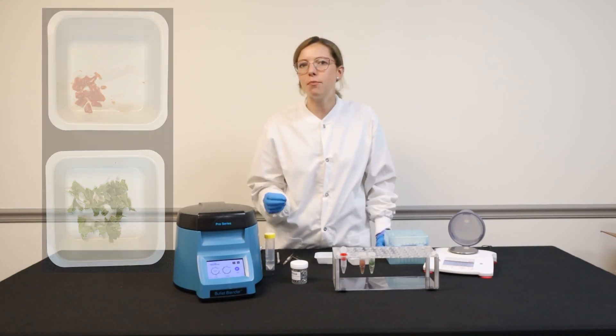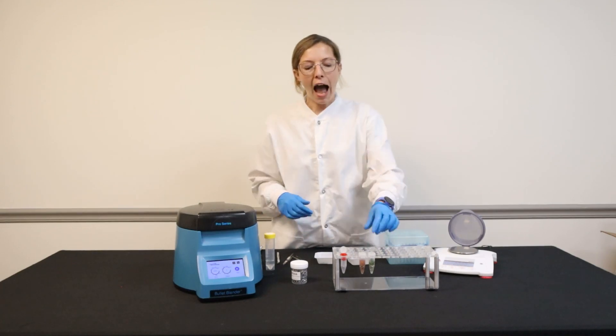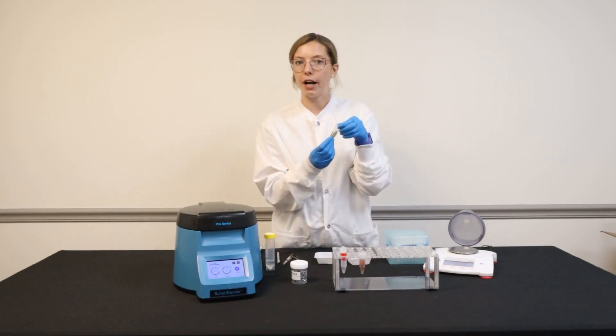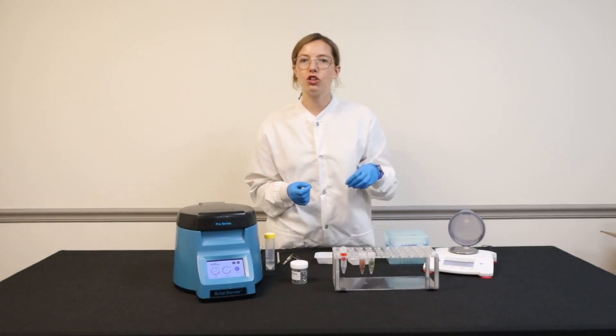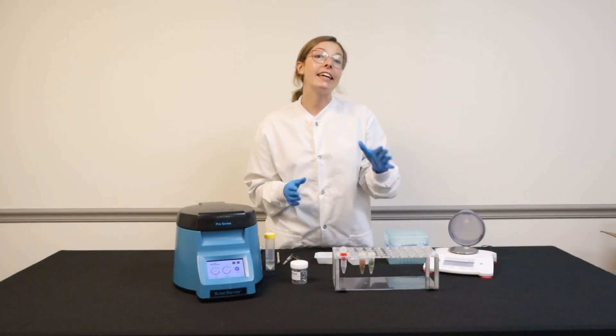I have two sample tubes all ready to go. You'll notice that they're in our Navy kits featuring those UFO beads, with 500 milligrams of each sample. Again, these tubes can handle up to one gram.